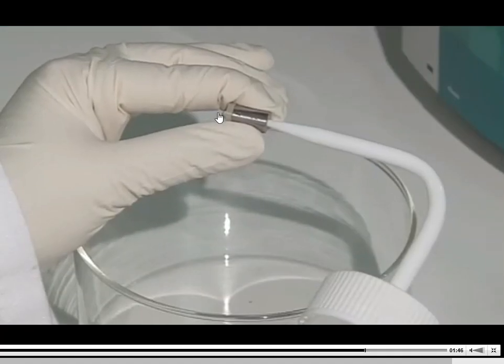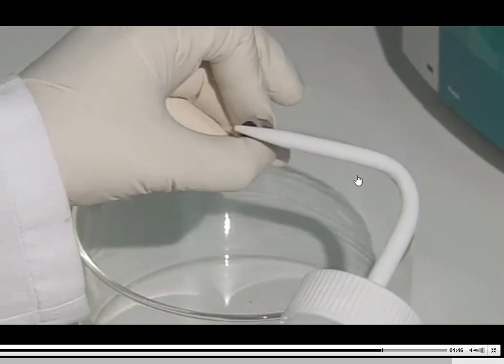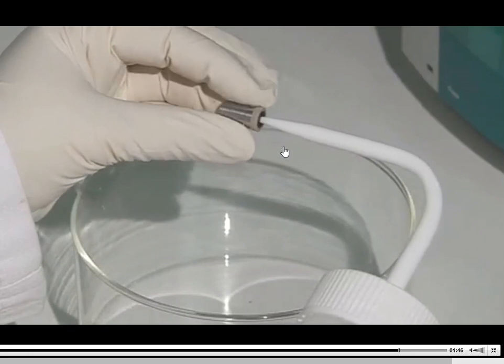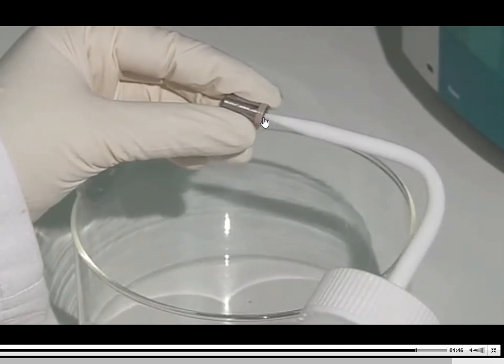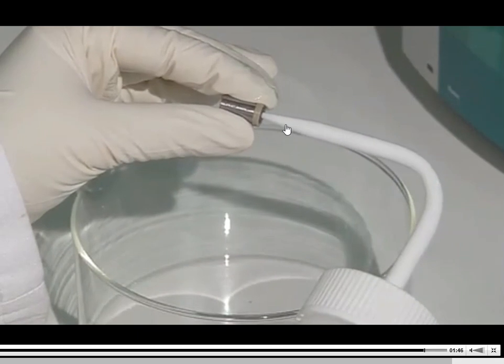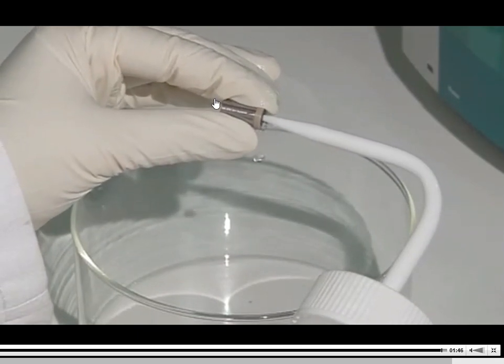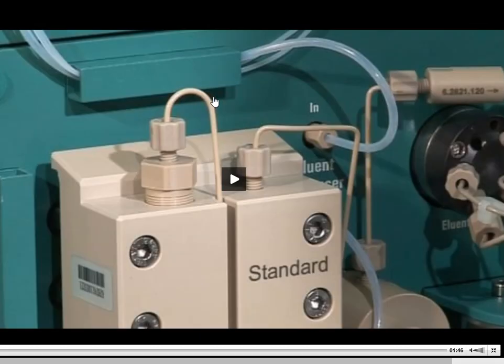They squirt water through in one direction. You see it came out of one end. They flip it around, and because it's only supposed to go one direction, it should not flow out of the other end. You're going to see the water drops come out of the front where the nozzle is and not on the back side. So again, that's a very good sign that these things are clean. They're not broken, they're not damaged, and they're doing what they're supposed to be doing.